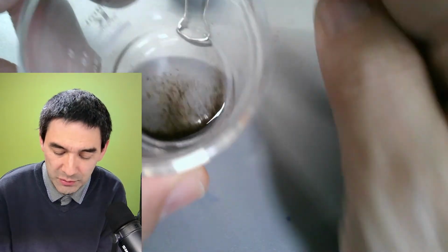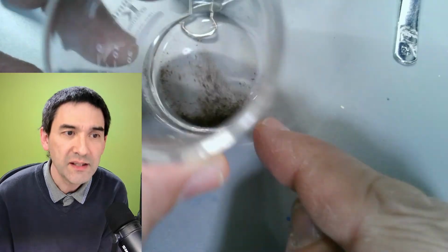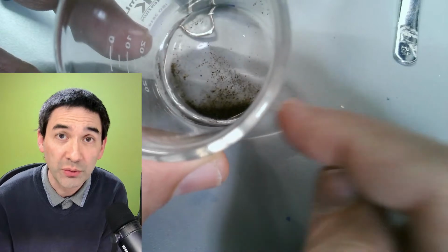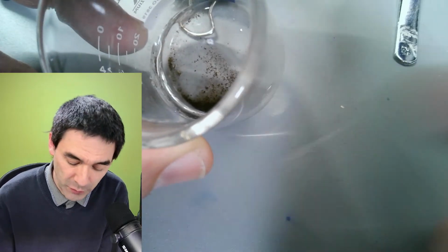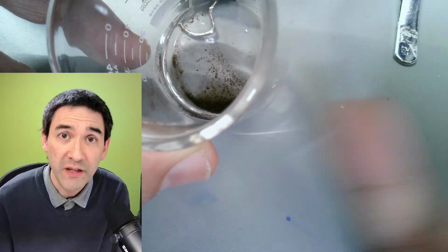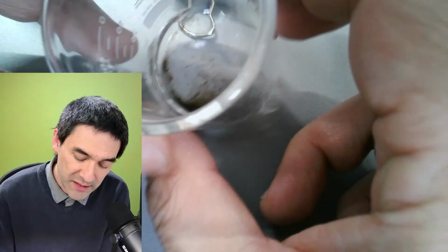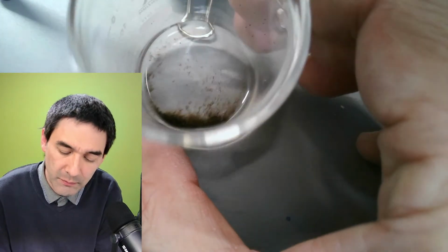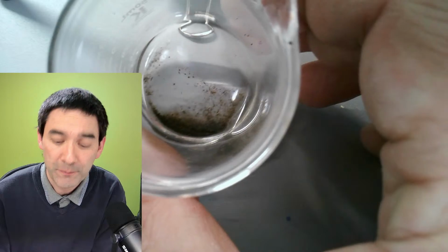I'm going to also collect some more samples. And this is actually quite a nice specimen to put under the microscope because it not only contains a lot of microorganisms, but of course, as I already mentioned, water bears, if you're lucky, lots of nematode worms and other things. So this is actually a very effective method of concentrating living things that can be found in moss.